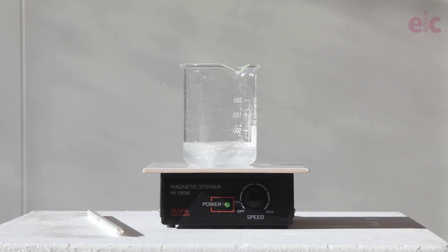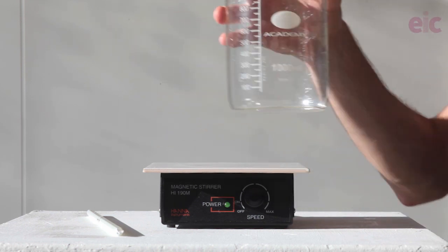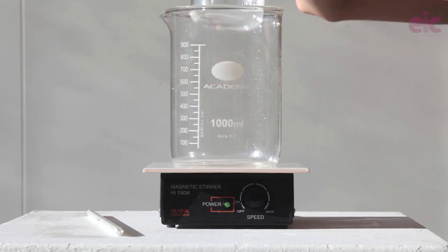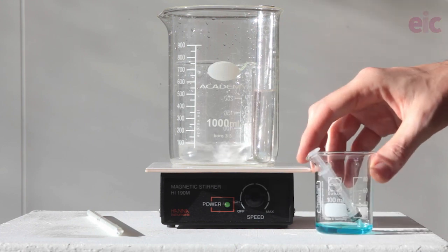To simplify some later steps, I'm popping the tartrate into a one-litre beaker and I'll put a white tile underneath to aid visibility of the reaction. I'll measure out 15 ml of the 10 vol hydrogen peroxide and put that into a test tube that's also in the one-litre beaker. These two solutions will be warmed up before the demonstration, but keep the rest of the peroxide aside at room temperature. Finally, pour a few ml of 0.5 molar copper sulfate solution into a beaker so you can easily draw up 1 ml with a dropping pipette or small syringe.